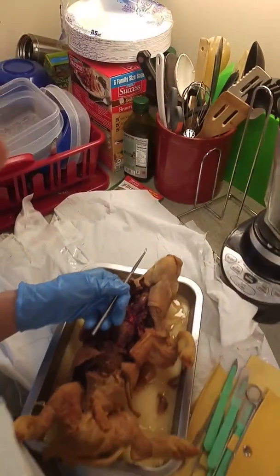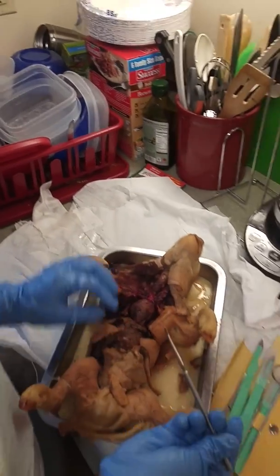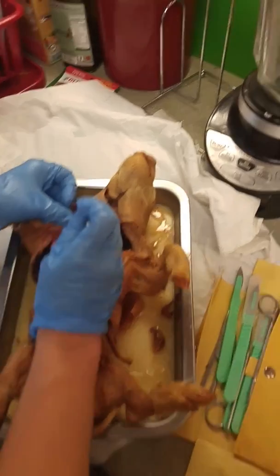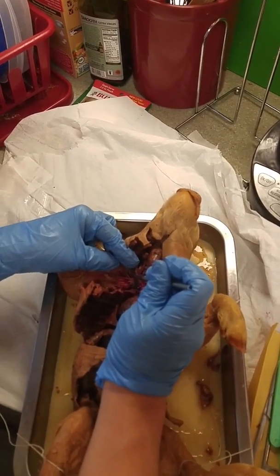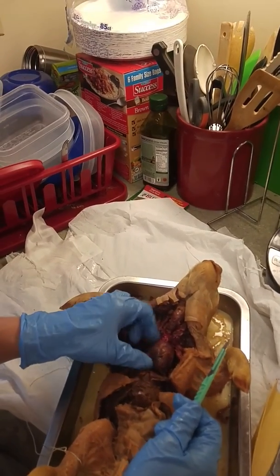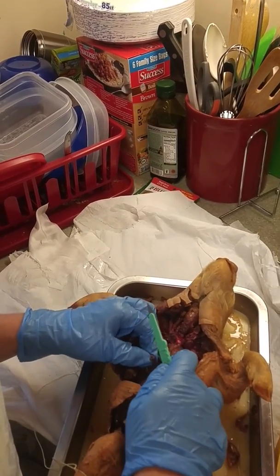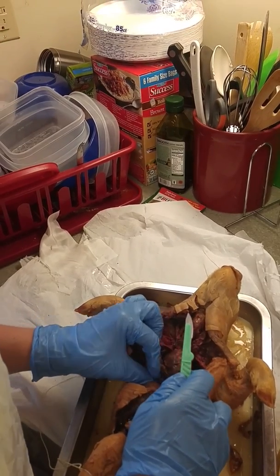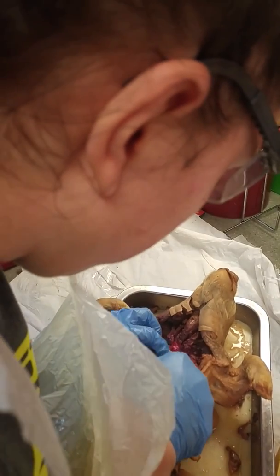And then for the lymphatic system, the right lymphatic duct would be on the right side here, running where the right subclavian artery is. The cisterna chyli is going to be above the vertebrae, below the diaphragm in the back. And then the thoracic duct, let's see, I'm going to cut the heart out.